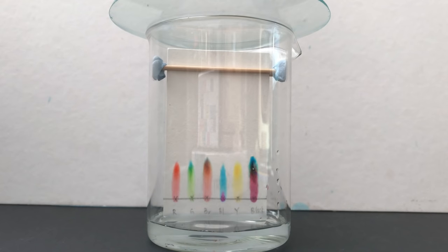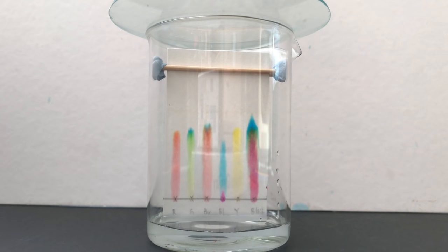You can see that as the solvent moves up the chromatography paper, it carries the different dyes along with it. Dyes which are more soluble in the solvent will migrate faster and further along the chromatography paper.